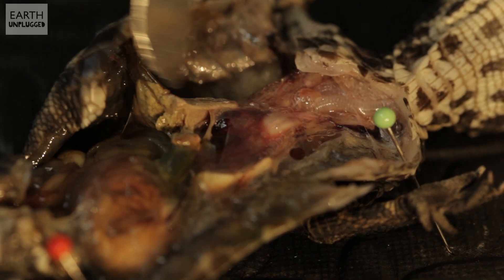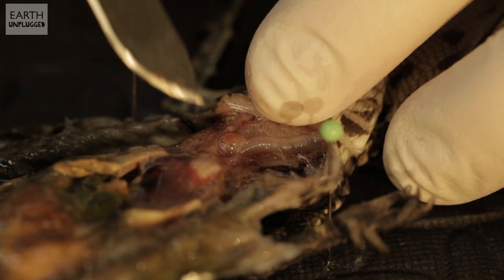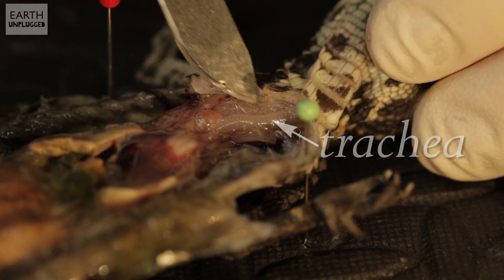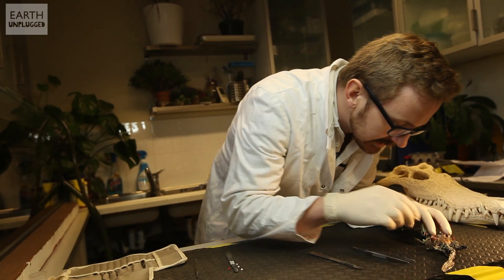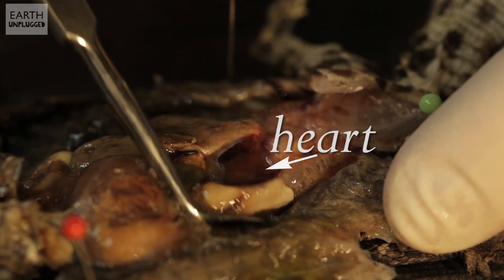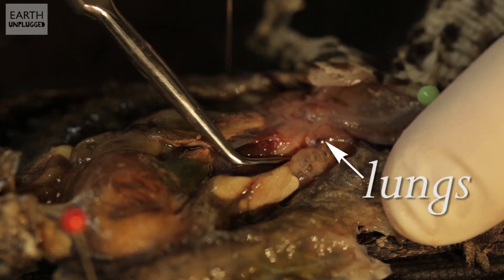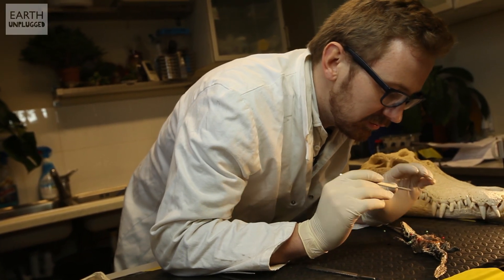It's a thing of beauty, believe it or not. So just here, if we can see it on the macro camera, is a sort of ribbed pipe, which is the trachea — your kind of breathing tube that goes down to your lungs. And just under here, that little dark red bit there is our croc's heart. And then this big old liver around the outside, and then in the midst of all this connective tissue are the lungs. And crocodile lungs are brilliant.